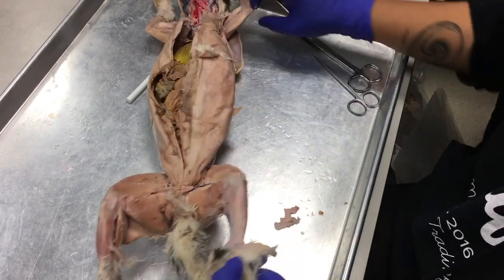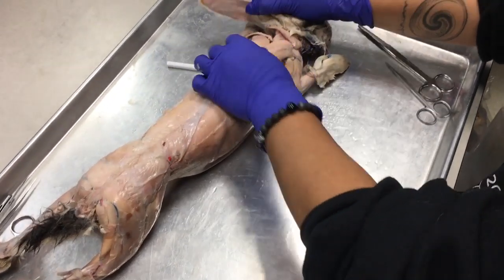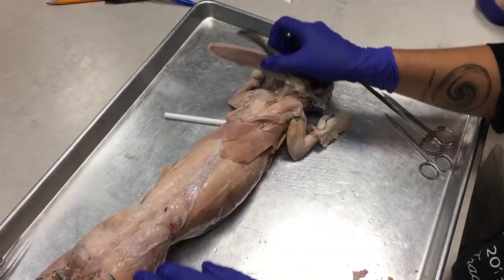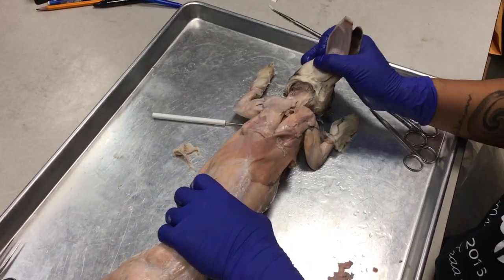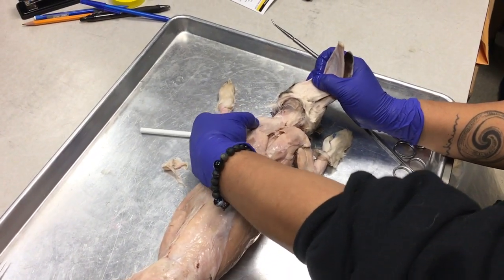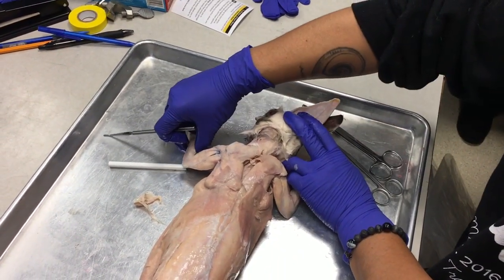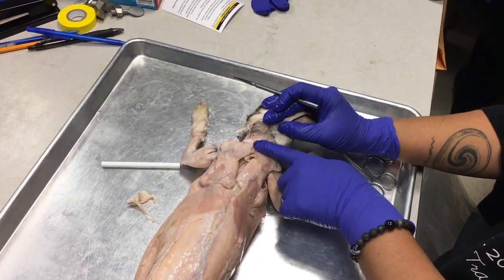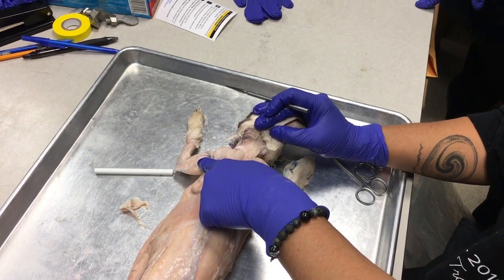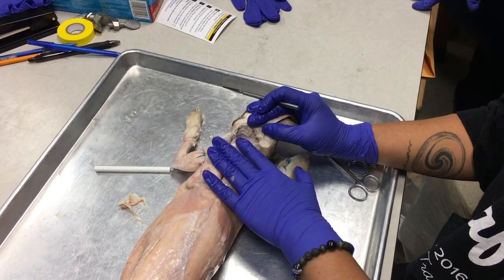Okay? So, now let's look at the muscles on the back. Okay, this is where I had trouble identifying muscles, so we only went with the few that I could find. Again, the first thing you want to do is stretch out the forearm of the bunny. And what you're going to find is that there's a big sheet of muscle extending from the nape of the neck all the way to the shoulder. So this is your most anterior deltoid muscle. This is called the clavodeltoid.